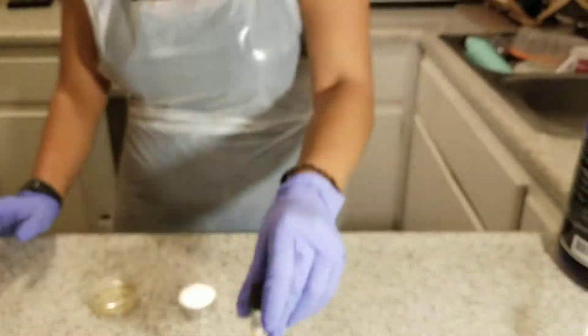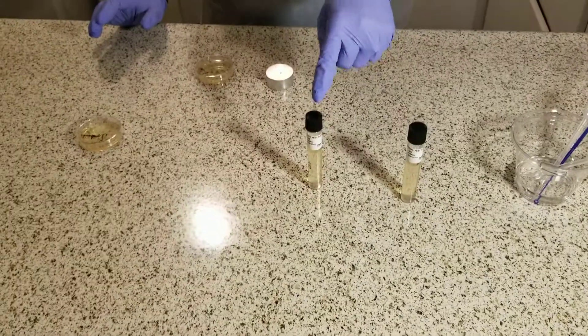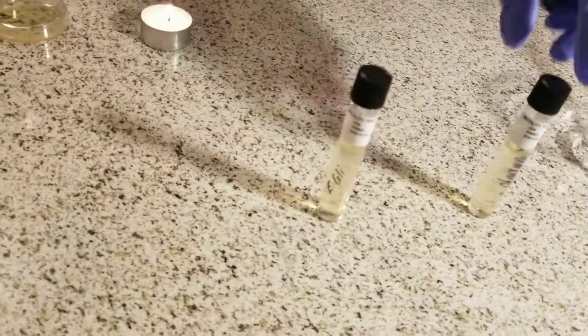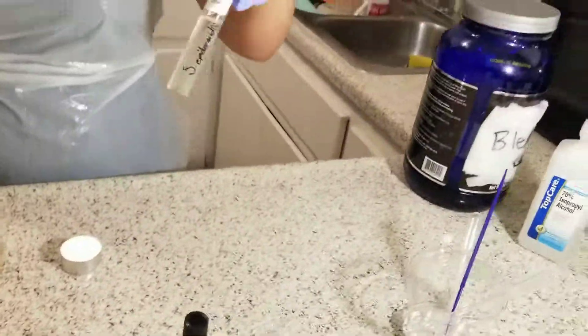I'll place this in the incubation location for 24 to 48 hours. Now I'll do the same with the second bacteria.